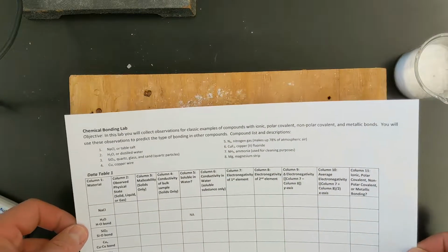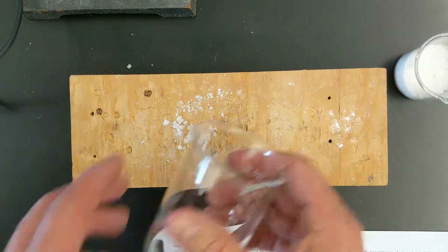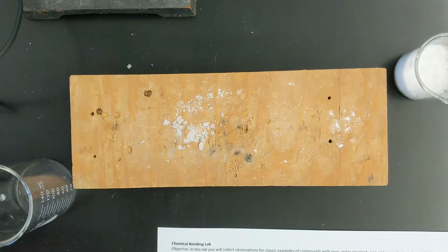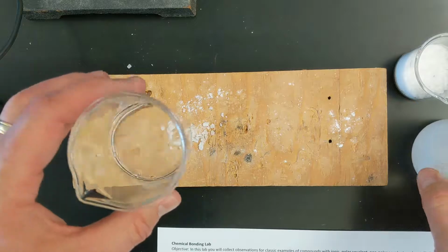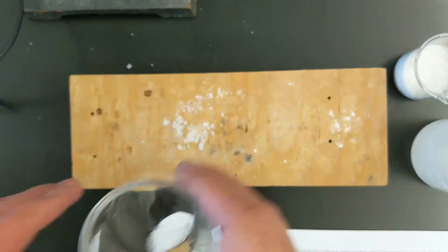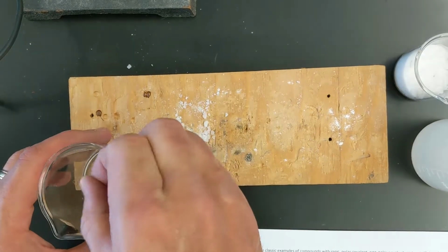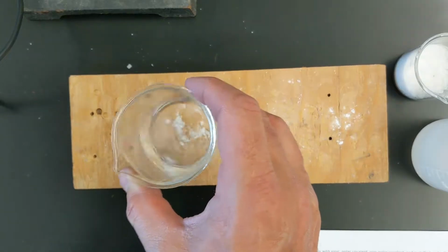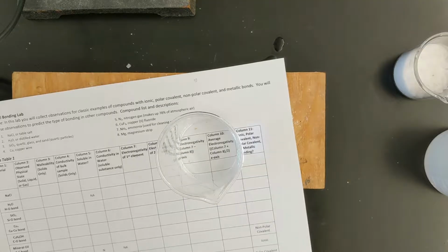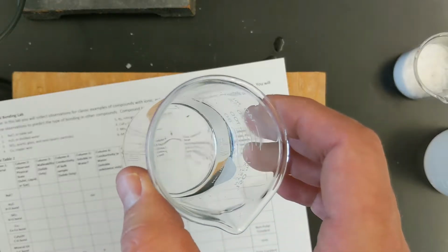So the next part here is solubility in water. We're going to take a small amount of our salt, and it's important whenever we check solubility that we pay attention to if it dissolves or not. That's really what we're looking at. So you can see I've just got some water here, and I'm going to put a small amount of salt in my solution. Now I've got some big chunks, so I'm going to pause and break these up a little bit. All right, I've taken the time to dissolve this, and I have my white background, and you can see that it's all dissolved.